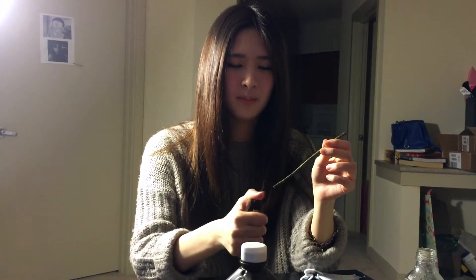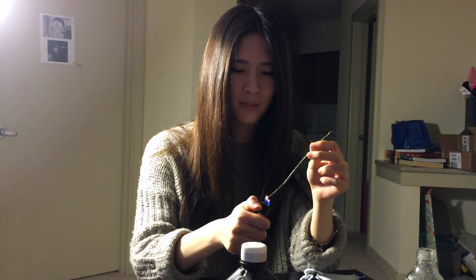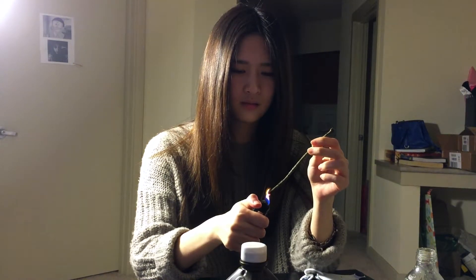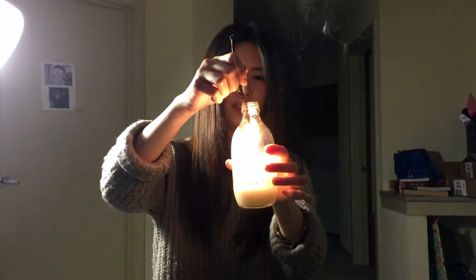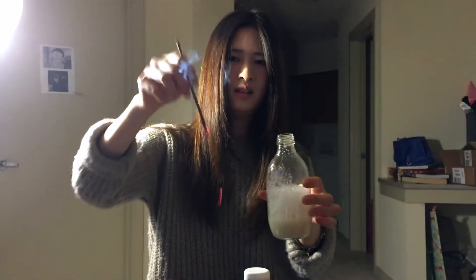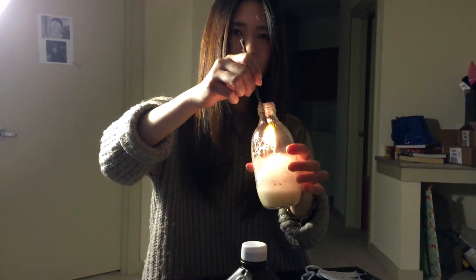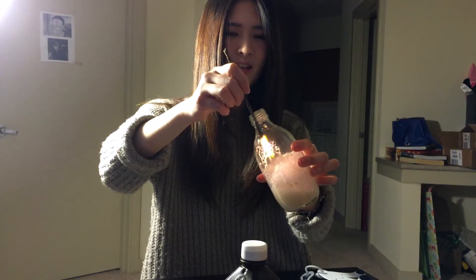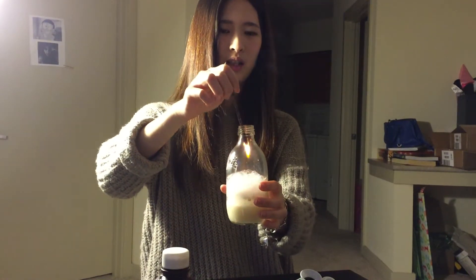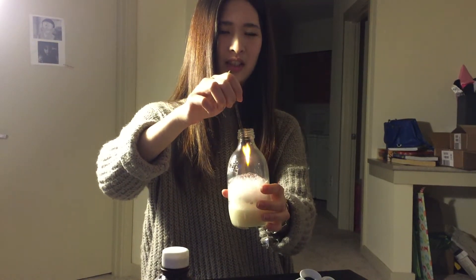Hi, I'm Joyce, and I'm going to do the explanation for our experiment. You react the H2O2 with the wooden stick — light it up, then put it into the bottle, and you'll see what happens. That's oxygen coming up from the reaction. Yeast is the catalytic decomposition agent.